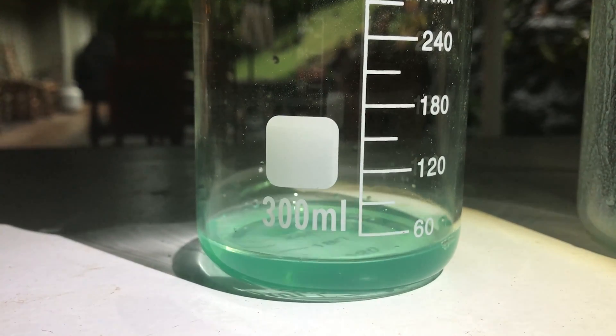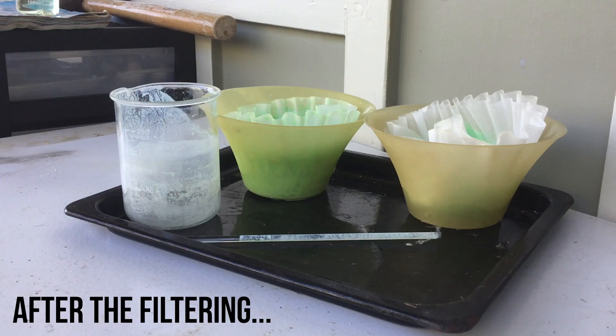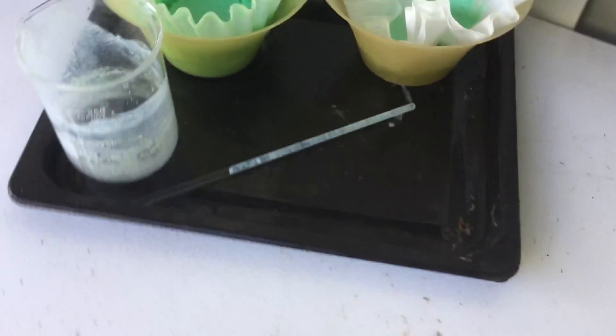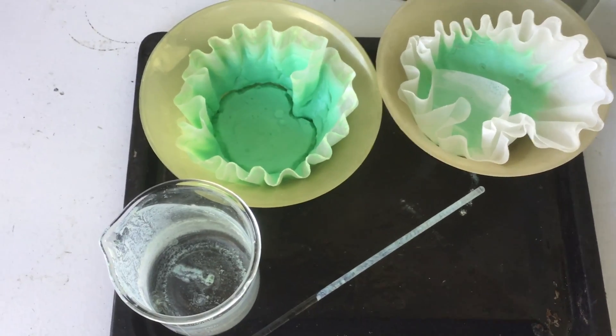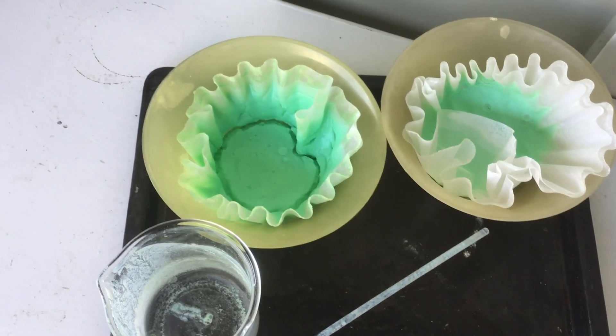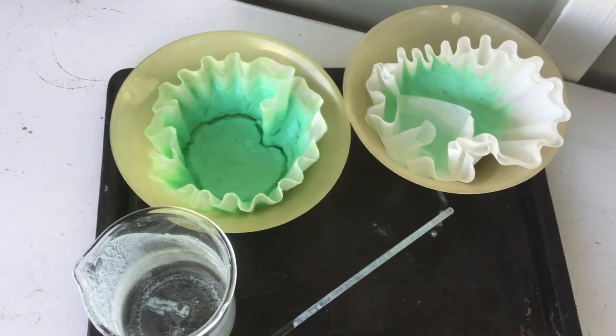Perhaps I'll add some more sodium carbonate and see if it reacts. I decided this is probably way too much basic nickel carbonate to put in a beaker and heat up, so I'm just going to spread it out on some paper plates and dry it first, then decompose it later in the week.